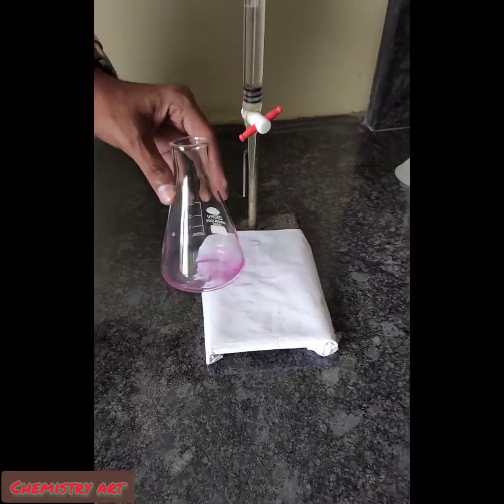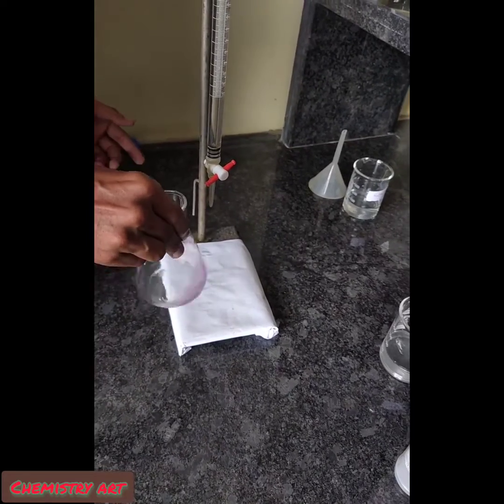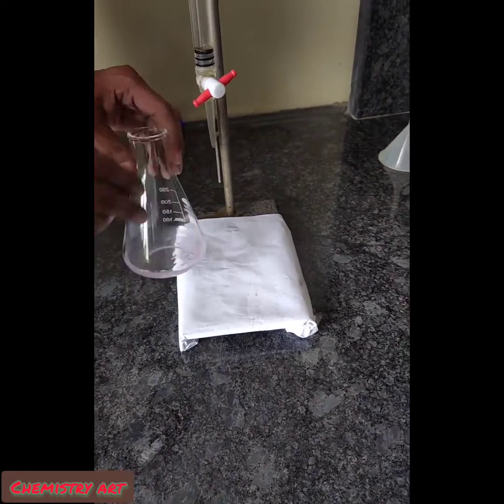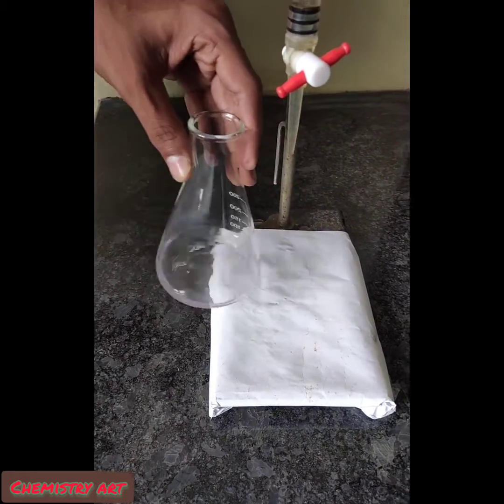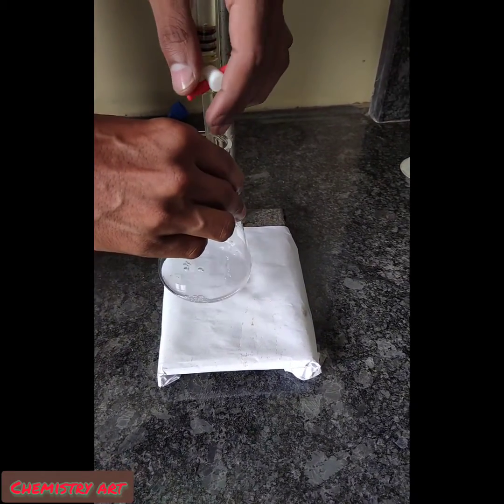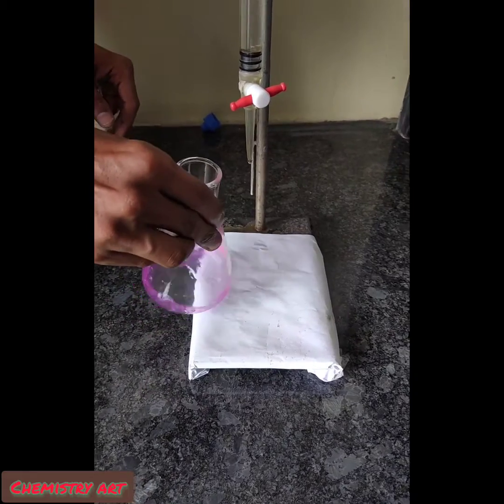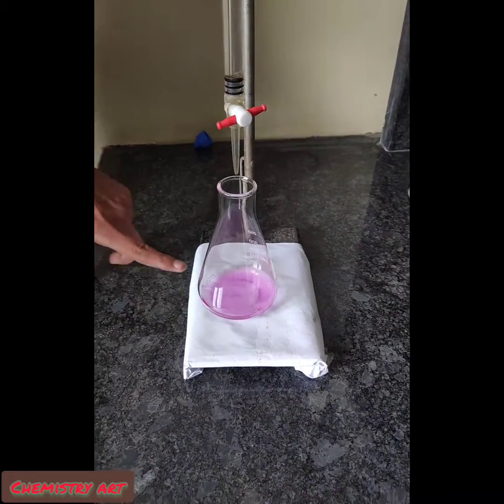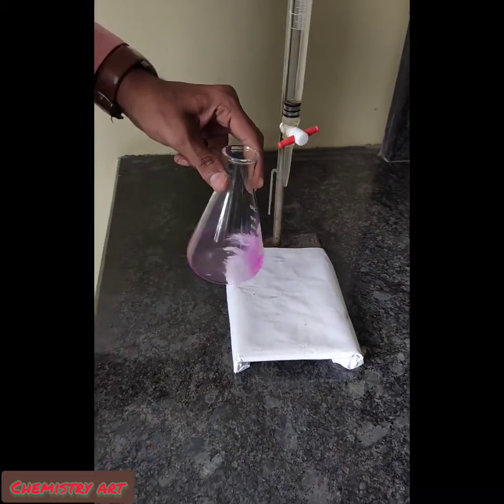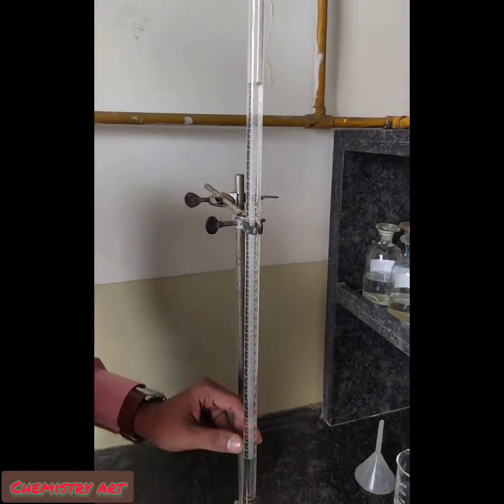You can see the color has come. Wait for 15 to 30 seconds to check whether the color is disappearing or not. The color is becoming very light — it is going to disappear, meaning my oxalic acid is almost neutralized. I will add one more drop and with this drop I get a very stable light pink color that will not disappear. This is our endpoint.